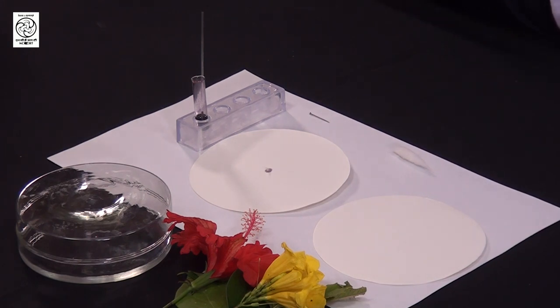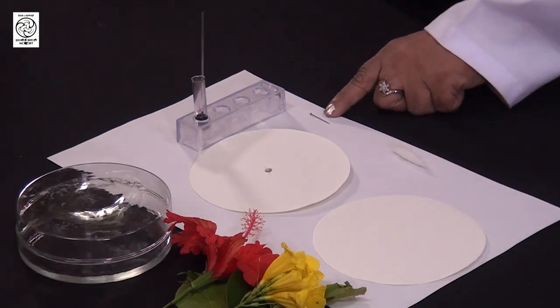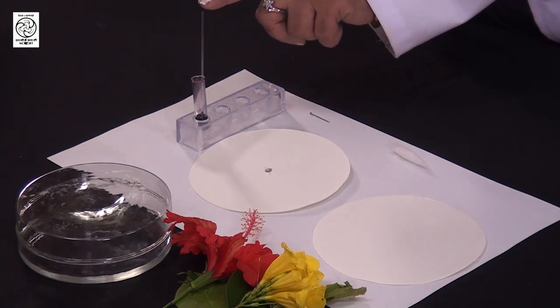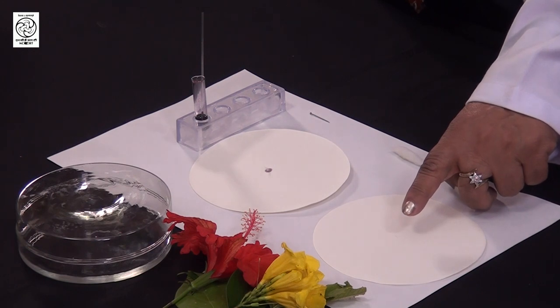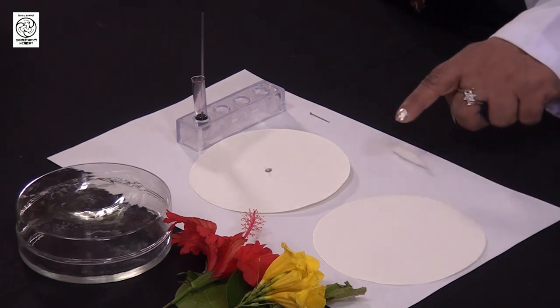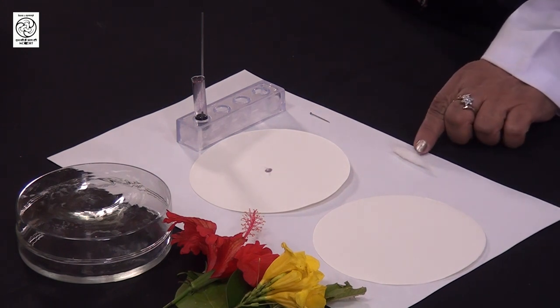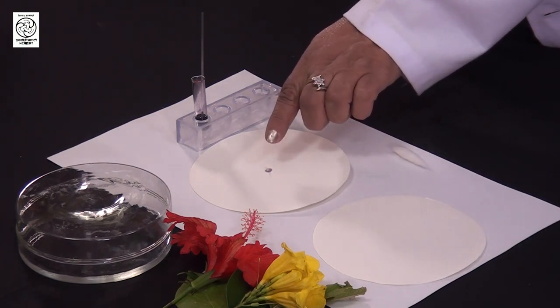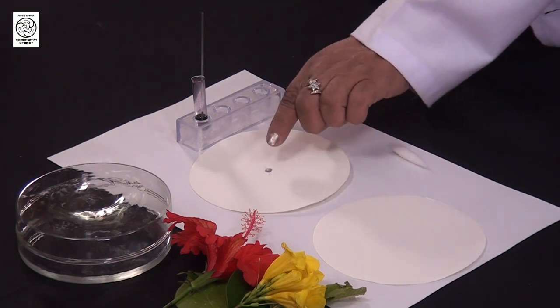What I will do is first make a hole in the center of this paper with the help of this pin. Then I will use this mixture to be separated with the help of this capillary. I will take a very small amount of this liquid and make a spot at the center of the paper where I had made the hole. I will let this spot dry completely, and then you can see here we have a wick made of cotton. We will place this wick at the center of the filter paper where the spot has already been made and dried.